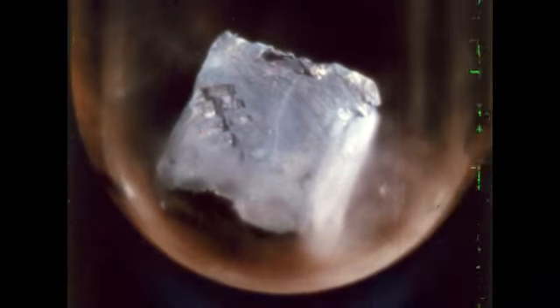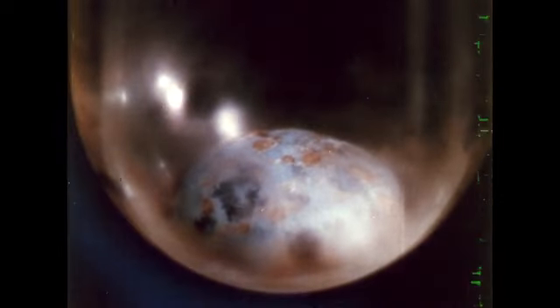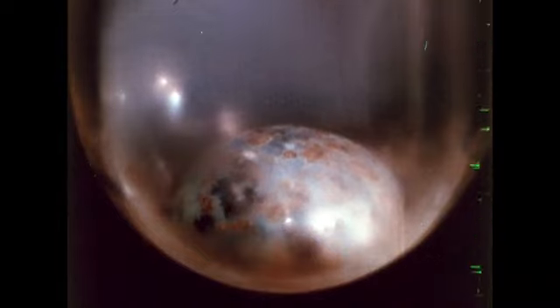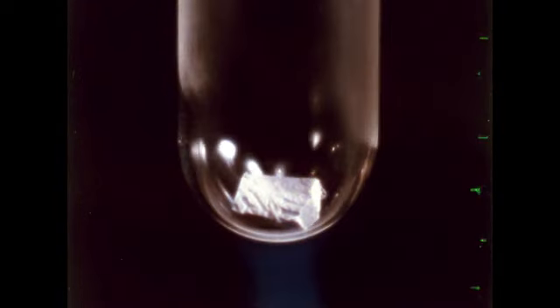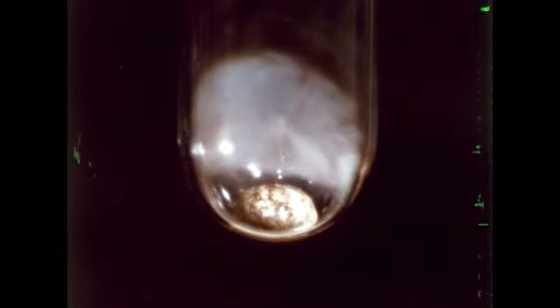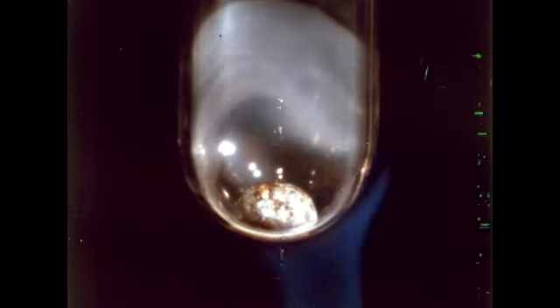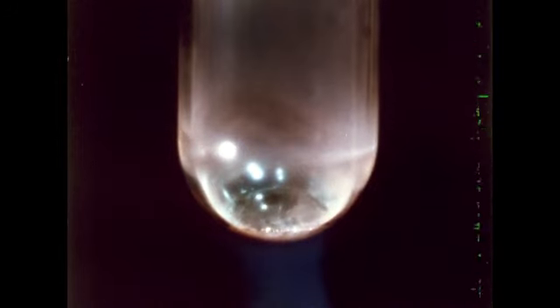When surrounded by gaseous helium, the potassium melts quietly. Oxide dust escapes, but there is no evidence of reaction. Apparently, helium is inert toward potassium. When we try hydrogen gas, there is little evidence of reaction at first. But gradually, reaction occurs and considerable white product collects on the sides of the tube.